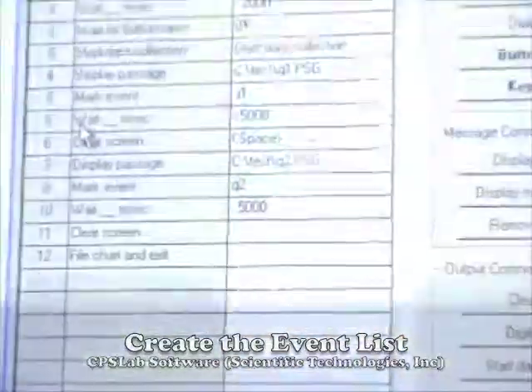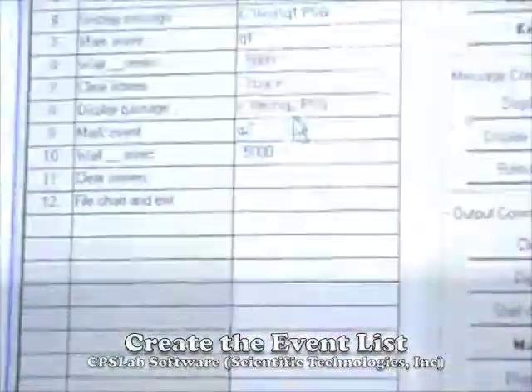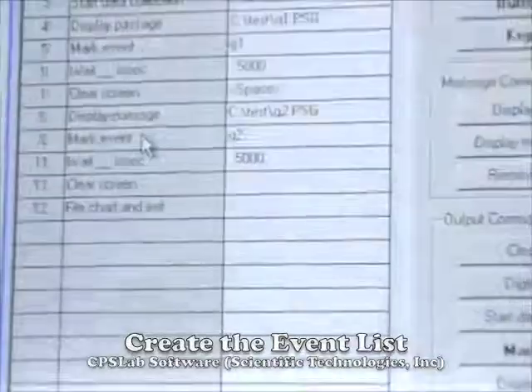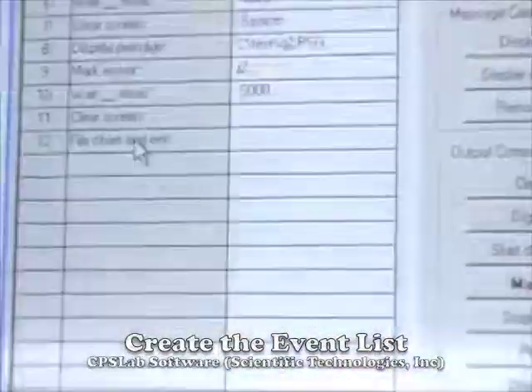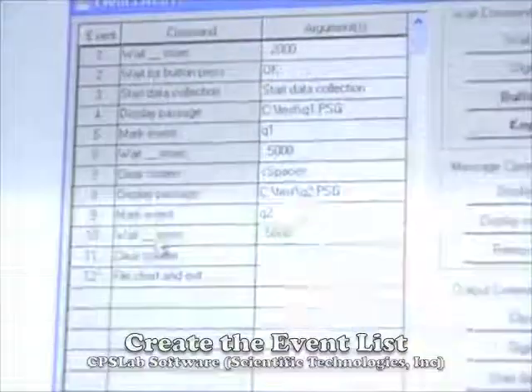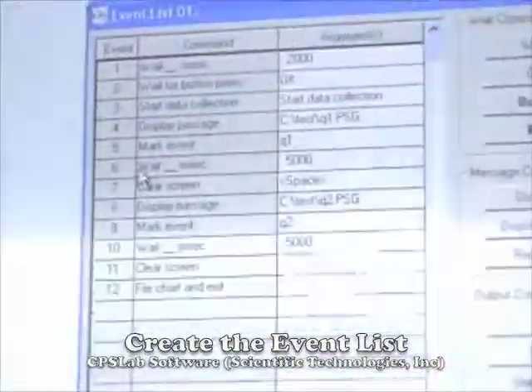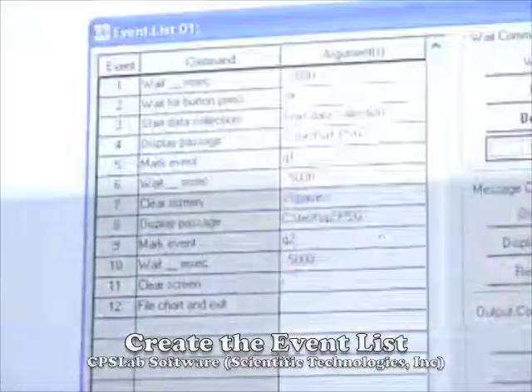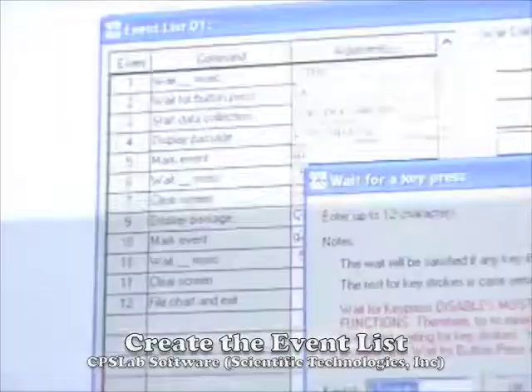Then we're going to wait 5 seconds. Then it's going to clear the screen, present another passage. This one's Q2, again marking the event, waiting 5 seconds, clearing the screen, and then filing the chart and exiting. So notice I haven't included any button presses from the subject, but you can definitely insert those. And to do so, all you have to do is click there and say key press, and then this would be waiting for a key press from the subject. But I'm going to choose not to at this point.